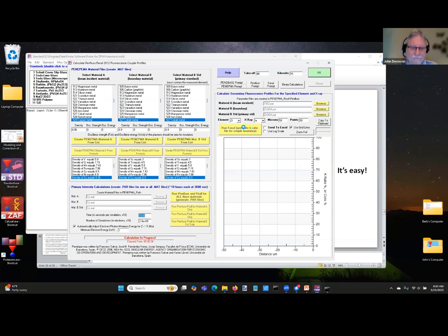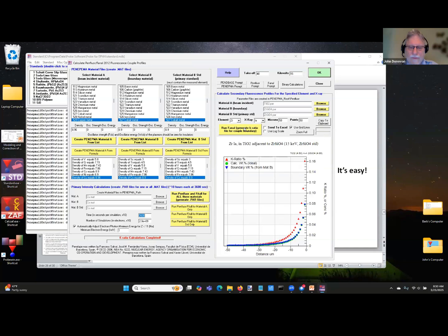It's so easy. And it runs for a few seconds, and there you go. So what you can see here, ignore the K ratio, but if you just look at the concentration, we've got about 800 ppm of artifact right here. 800 ppm at 1 micron from the boundary.